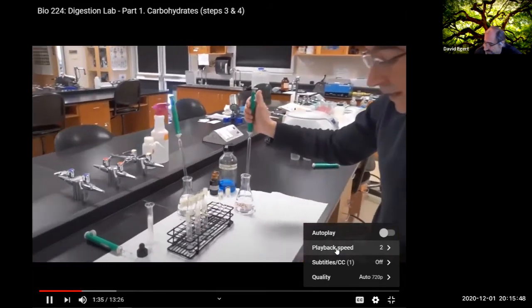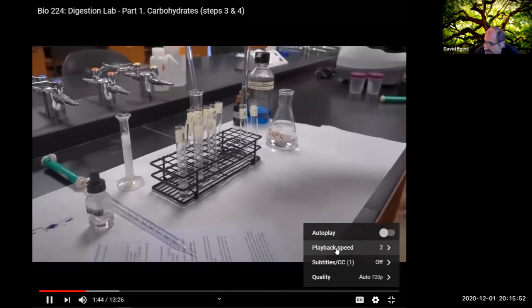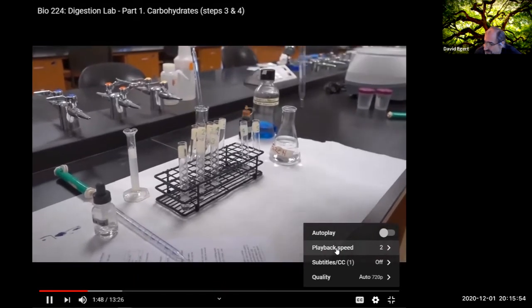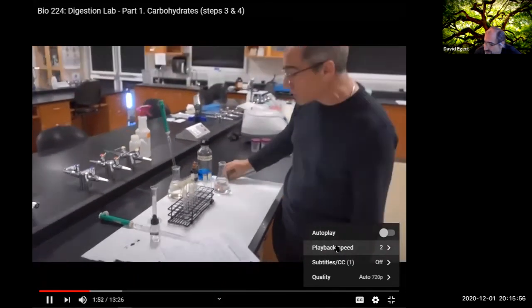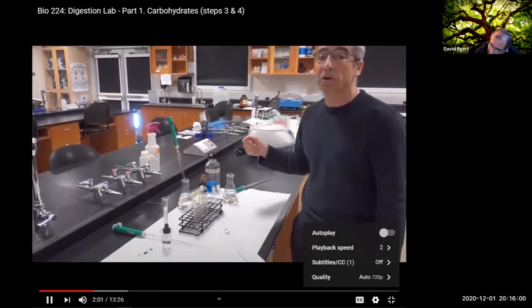So for test tubes 4 and 5, we're going to have test tube 4, which is just going to have pure starch in it. And when we do our test, it better say that it just has starch in it. Test tube 5 is where we're going to have pure maltose. I'll put that in a little later. And so when we check our assay for maltose, that better say pure maltose with no starch.